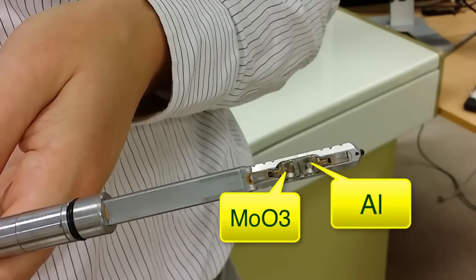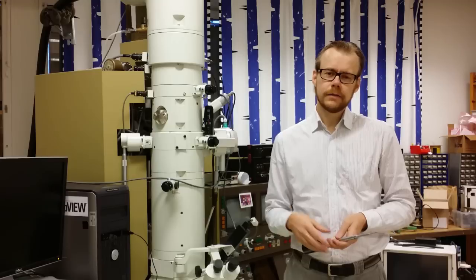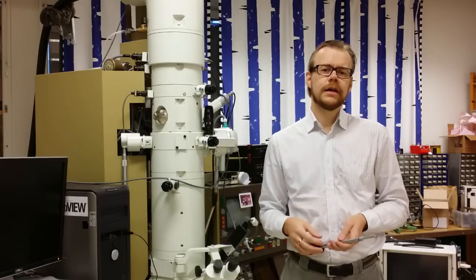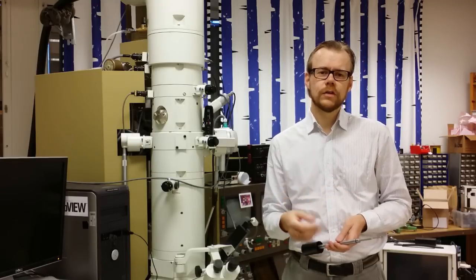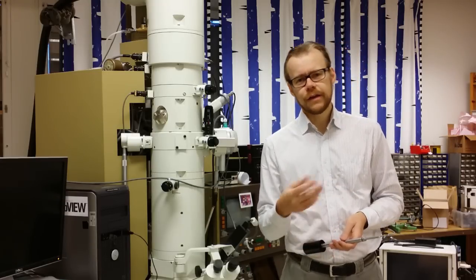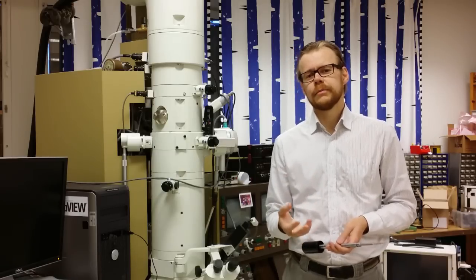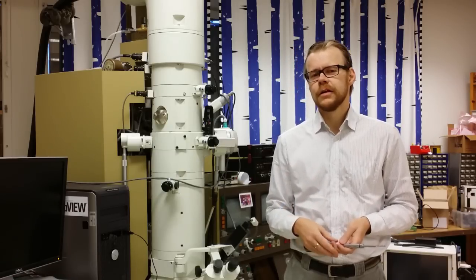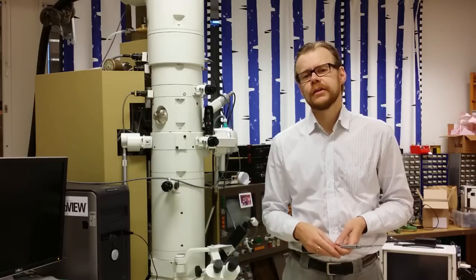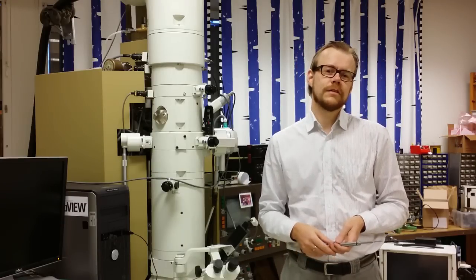So I also have the second sample here — it's a sputtered aluminum sample. By checking that, we can calibrate the system. We can also demonstrate the effect of having polycrystalline materials and how the electron diffraction looks in that case.